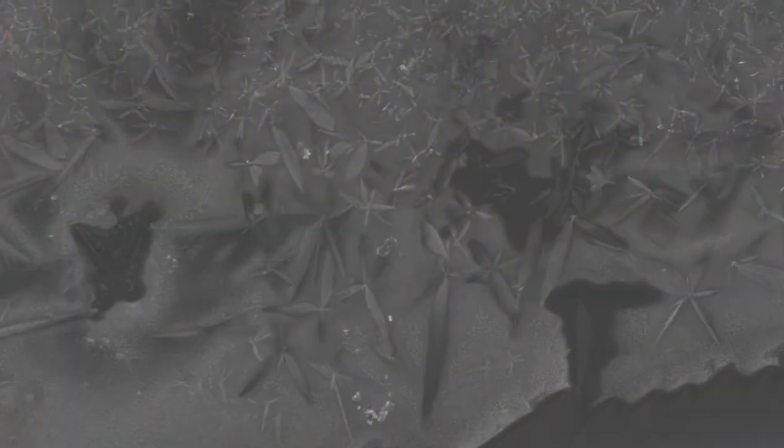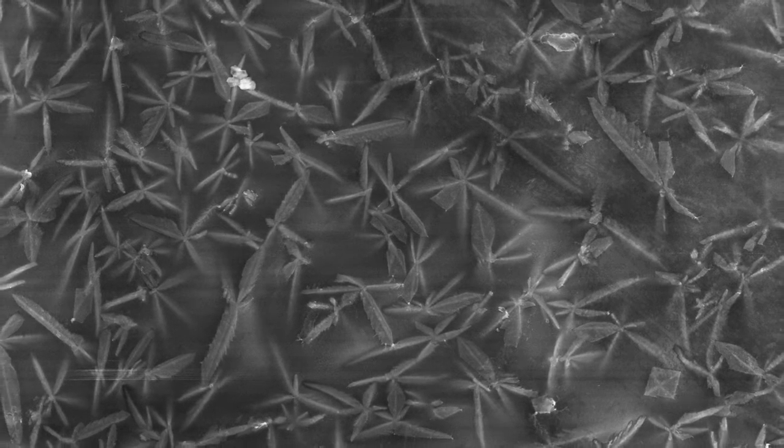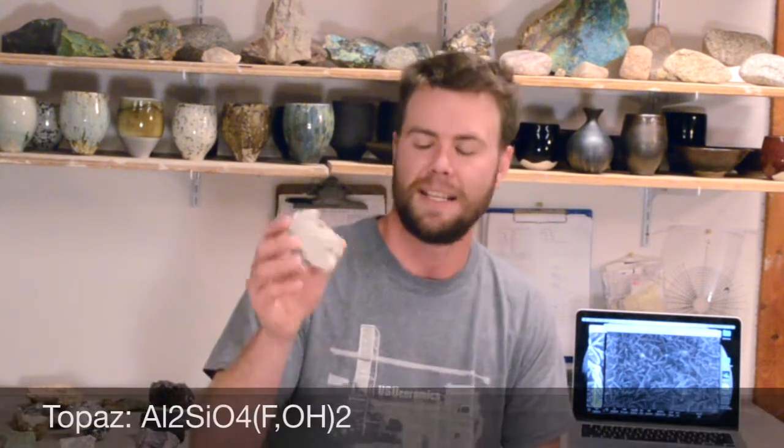And this one is really interesting. I didn't have a whole lot of time to research this glaze, but when we got up past 1,000 magnification, we found fields and fields and fields of these really interesting crystals. Essentially what we've got are iron silicate crystals growing out of these central little points. And what I speculate is that the rhyolite that I'm using has tiny pieces of topaz, and this sample actually has a lot bigger pieces of topaz.